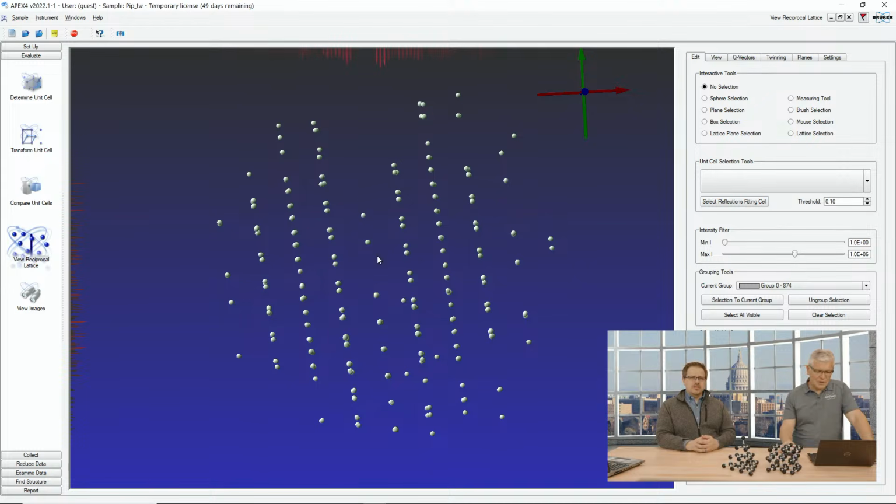Where we have reflections at the zero layer here that all overlap, and then we have two arrays that are just oriented in different directions. In this case, it's a non-merohedral twin, so they do not completely overlap. But this is a special case, because you see that in every fourth row, the reflections overlap completely. They come back together. And this is called a reticular twin. So here you have a mixture of non-overlaps and complete overlaps.